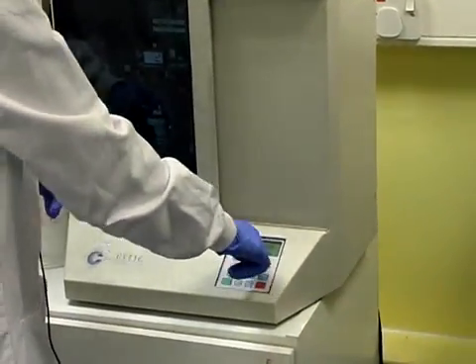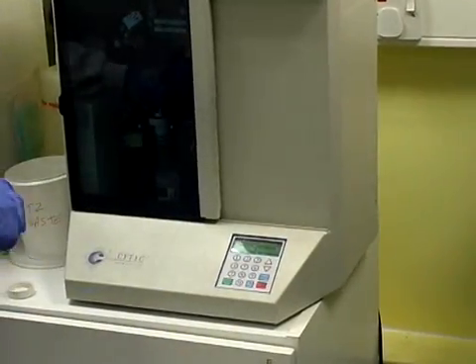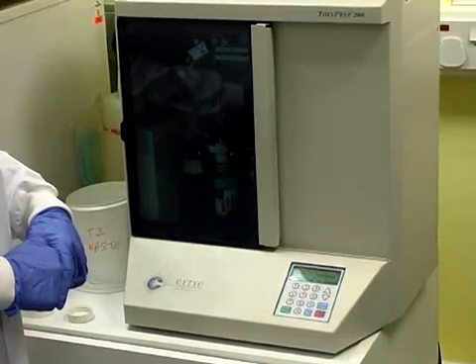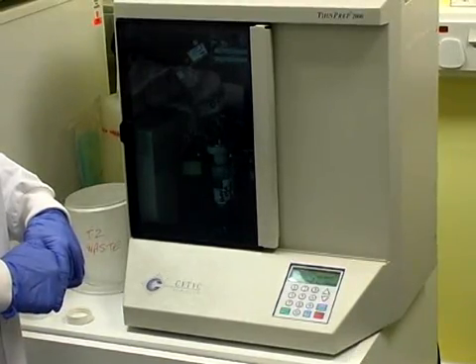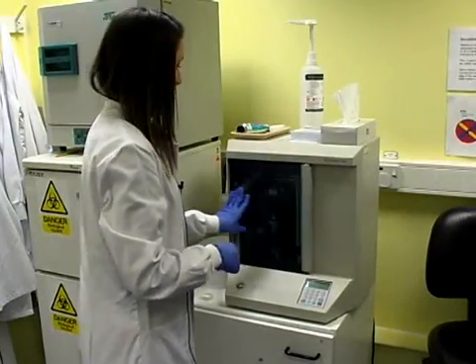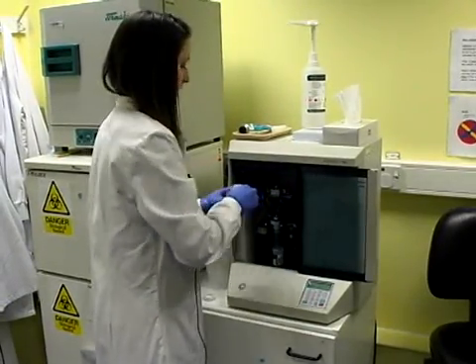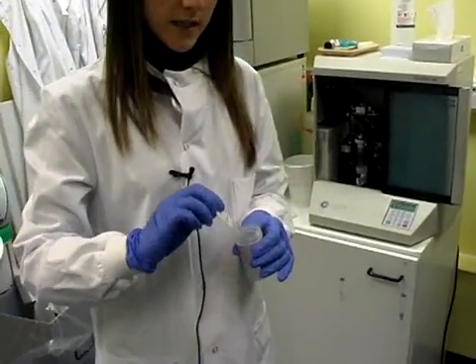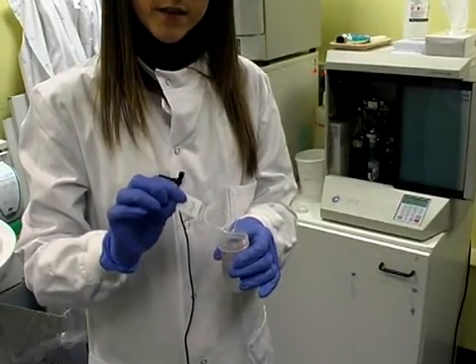For a mucoid sample you press 3. Once the programme has finished, we open the door and the slide will end up in the alcohol pot, which fixes it so it doesn't dry out.